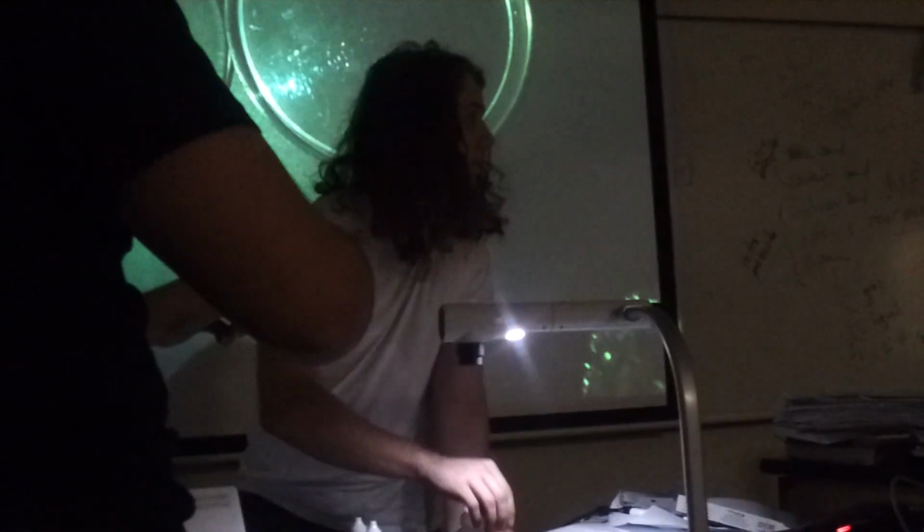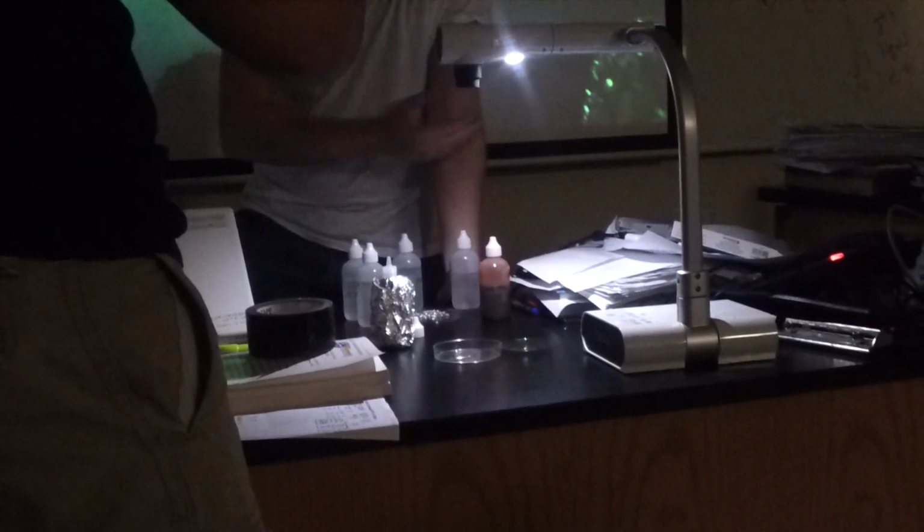You want to explain what you're doing with Storm? Yeah, okay, so there are a few chemicals I'm going to add here. There's sodium bromide, sodium bromate, sulfuric acid, something called malonic acid, and an indicator called ferroin. And this isn't a pH indicator like most of them you've experienced by now. It's a redox indicator. It measures the oxidation state of an iron atom there, and that changes the color from red to blue, depending if it's oxidized or reduced. I don't remember which one is which, but it's not really important for the reaction.